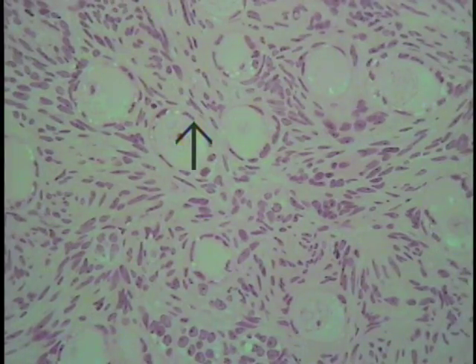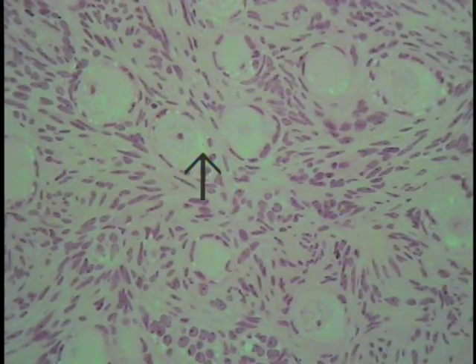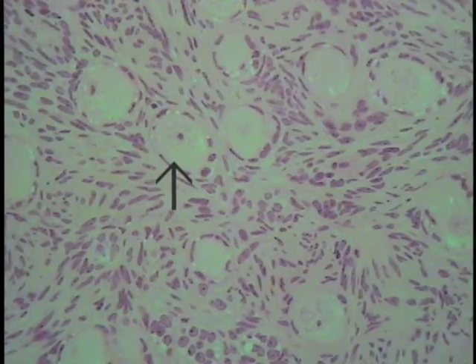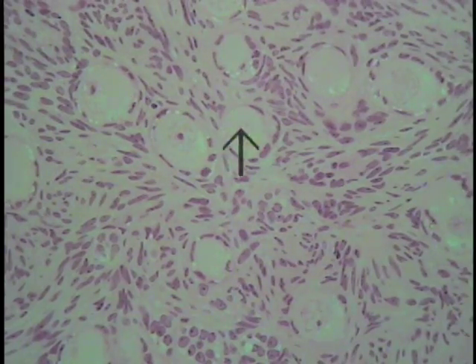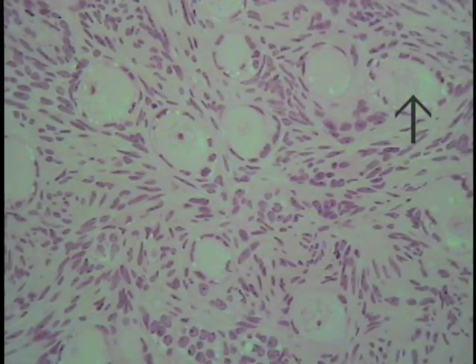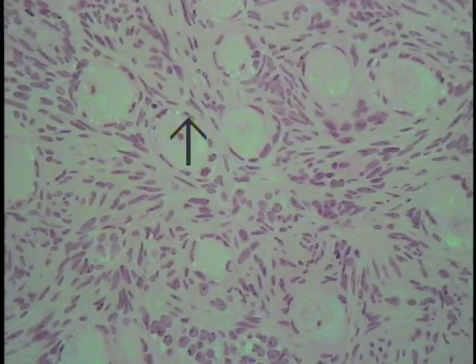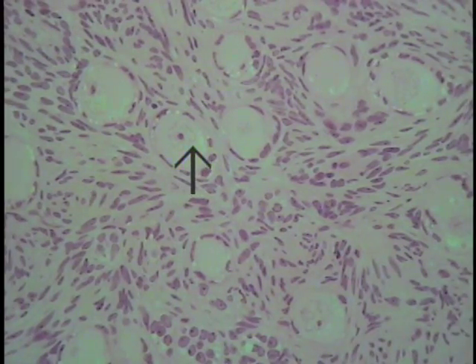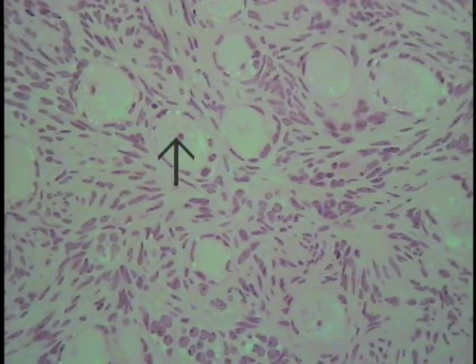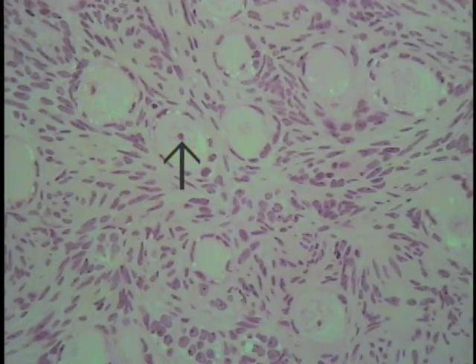Looking at this particular field once again at increased magnification, this structure here indicates the perimeter or the overall circumference of an individual cell. So this indicates a cell, as does this large spherical structure and this one over here as well. What can be demonstrated in this particular field is the cytoplasm of a cell, the nuclear envelope, which begins at approximately this location, indicating the nucleus located here.